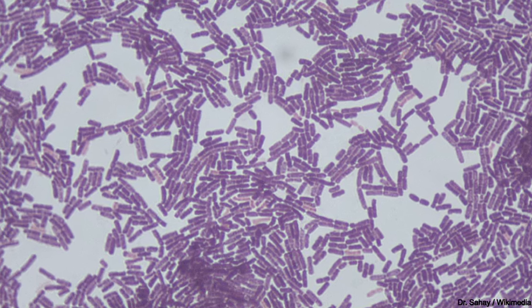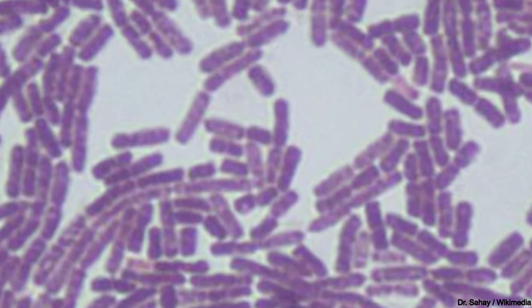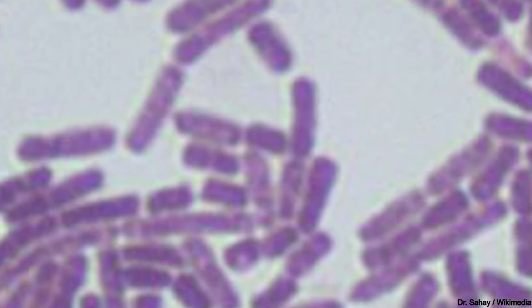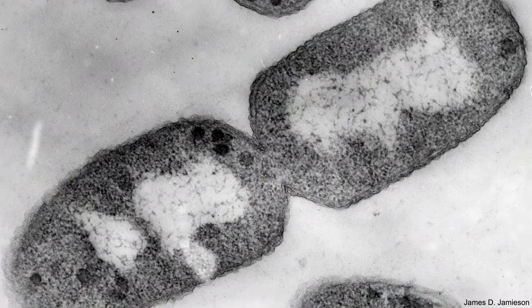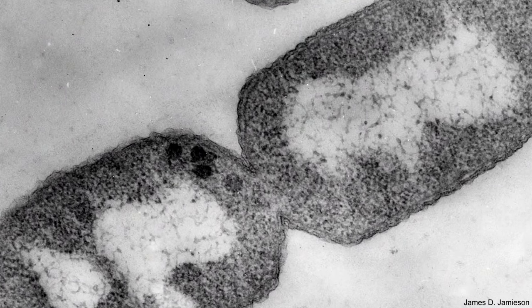The amount of magnification that can be achieved by a light microscope is limited to the wavelength of light. As a result, objectives higher than 100x are not used on a light microscope, as it will have reached the limitations of its resolution. If a higher magnification is desired, then other microscopy techniques such as electron microscopy are used.